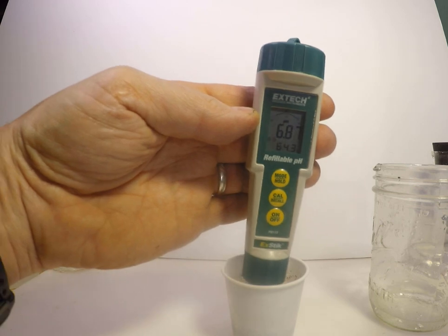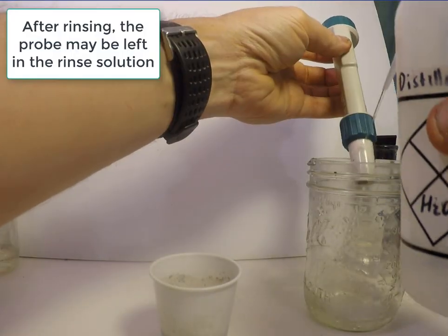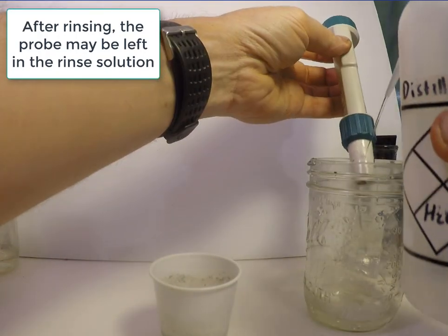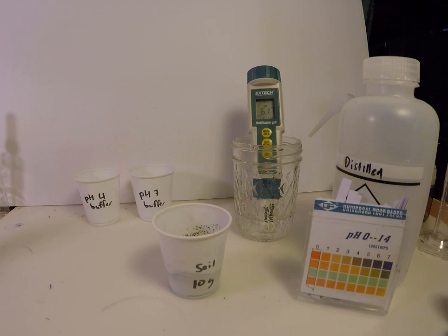Then, the probe is rinsed and placed back in the storage area. The rinse bucket is often a reasonably convenient place to put the probe, since it will have a pH and solution strength relatively close to the soil samples being read.